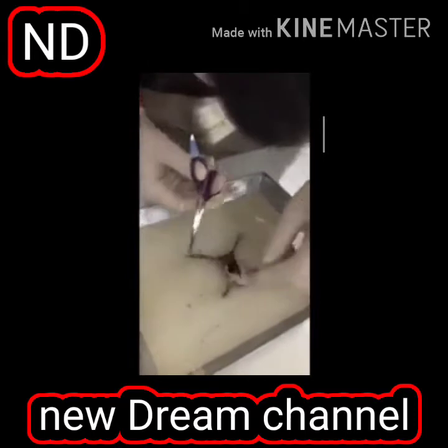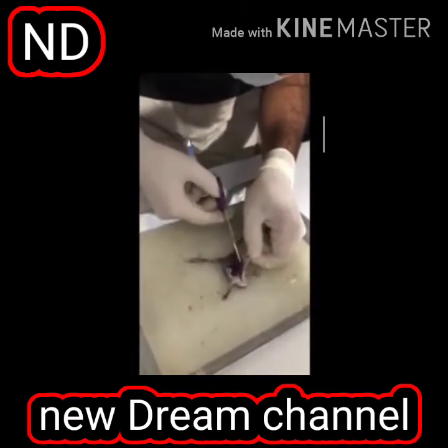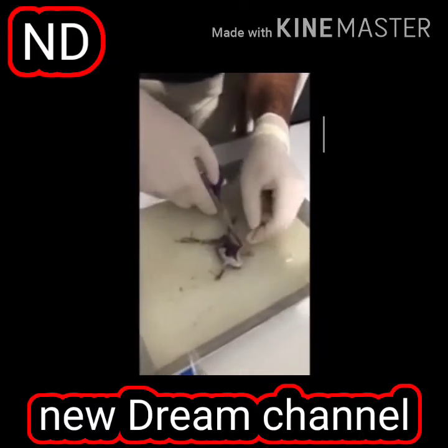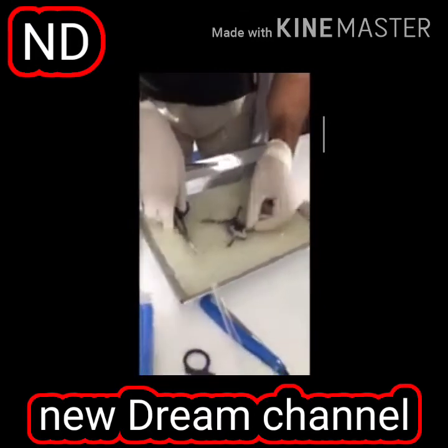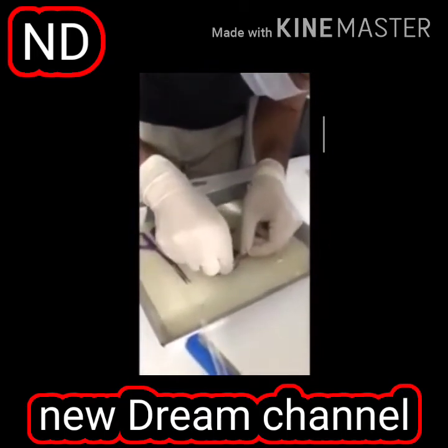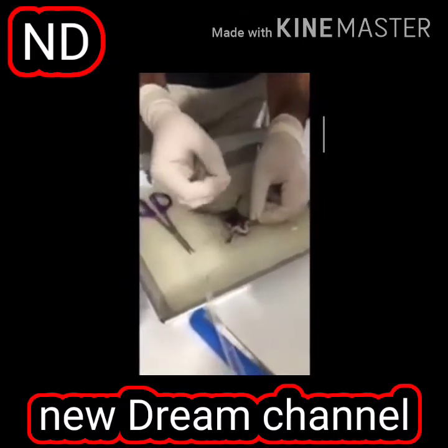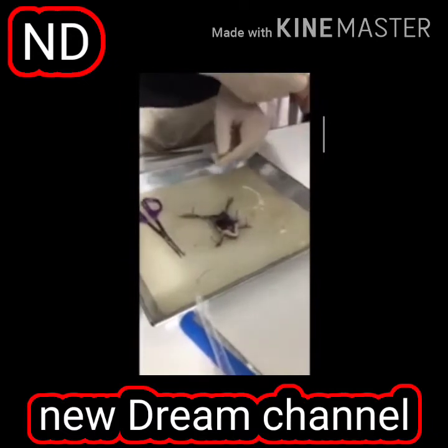We'll do it like this. And what will we do? What will we see? Can I have some more pins? Yes, sir. I will pin its skin on both sides.